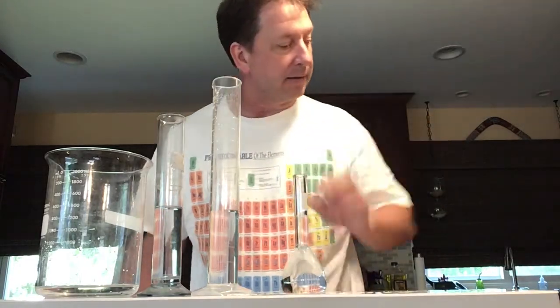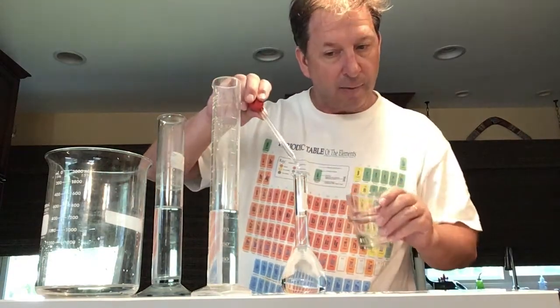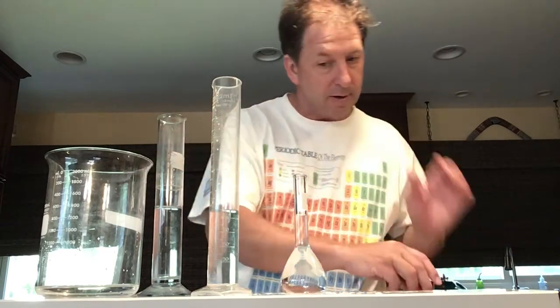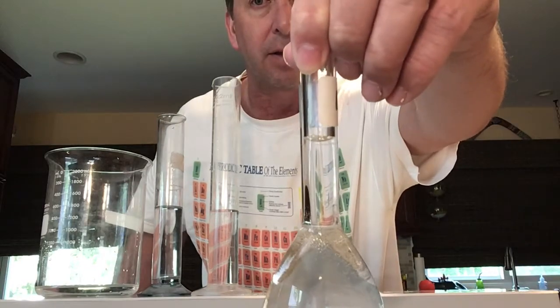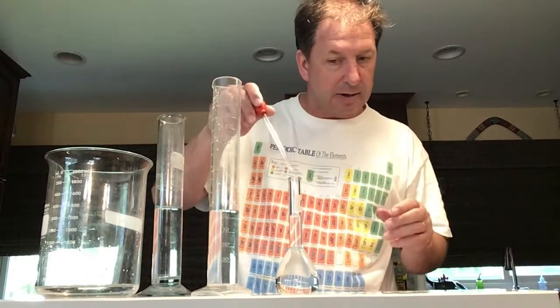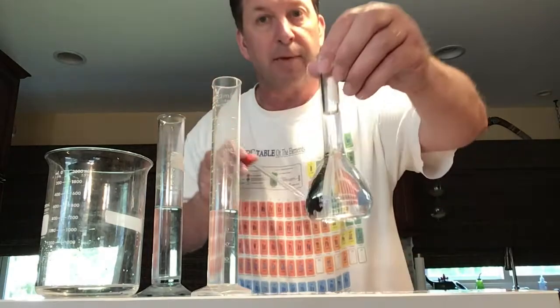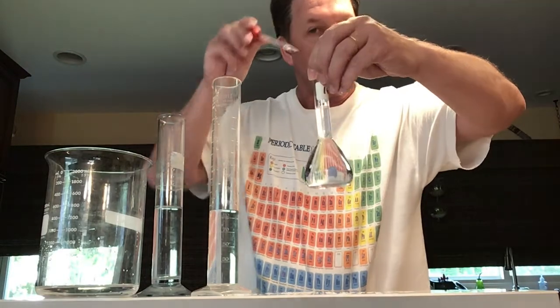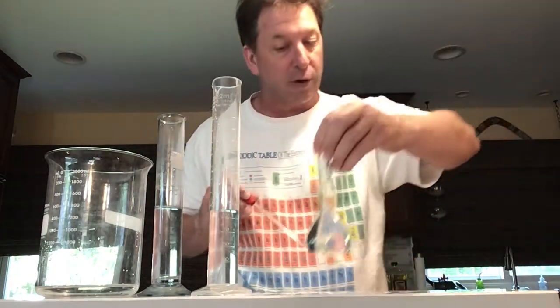If we were to add just another tiny drop of water, maybe one or two drops, it would then go over the 100 milliliter mark. We can see that's above that level. And then we would try to go ahead and suck out that little tiny bit. So this is going to record 100 milliliters pretty much to the nearest droplet or so. Maybe it took out a little bit too much. So there we are, we're really close to 100.0 milliliters.